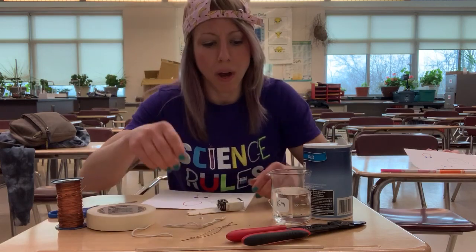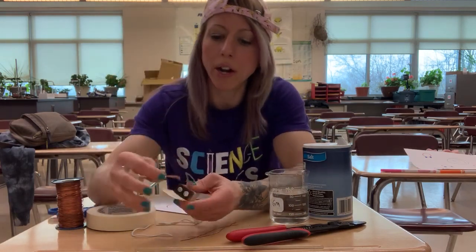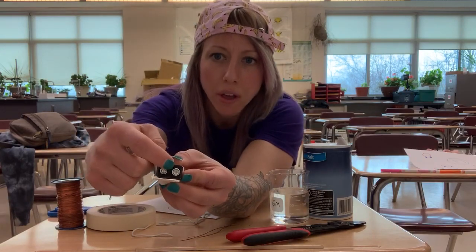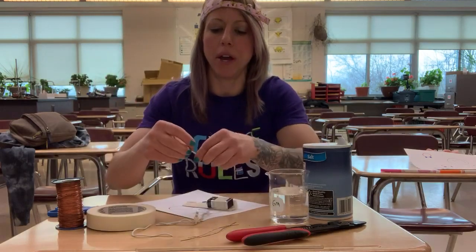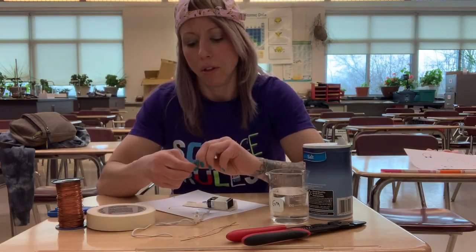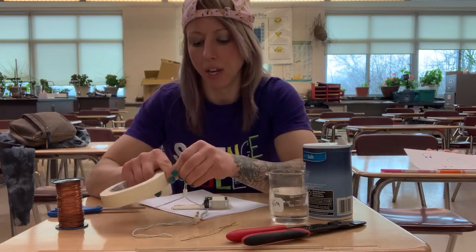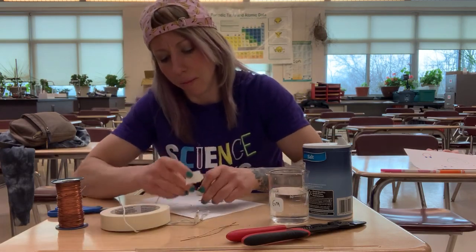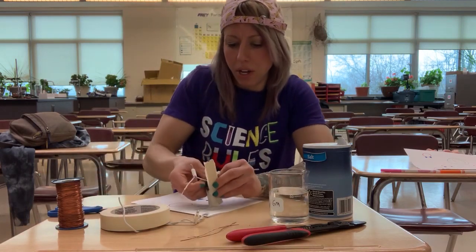Now I'm gonna take my Christmas light, and I'm gonna take one end of the wire and sort of jam it into the bigger end of the 9-volt battery. It doesn't matter which side. I'm kinda gonna wad up the copper here and stick it in there. This actually would work a lot better with electrical tape, but I couldn't find it in my lab here and I'm trying to hurry. So I'm going to tape that in just so it's held in place.